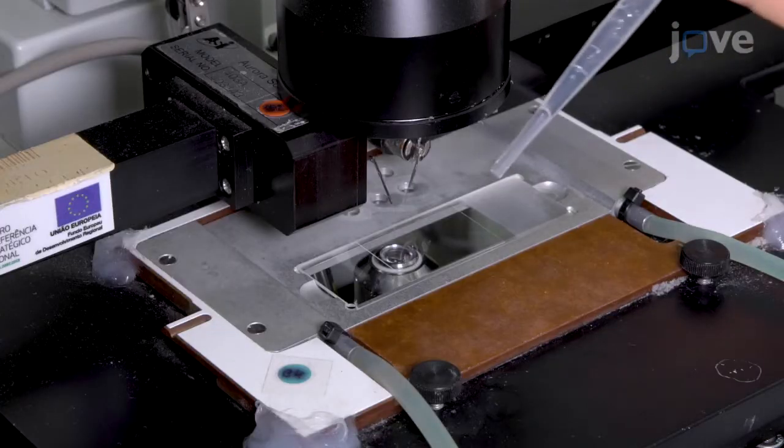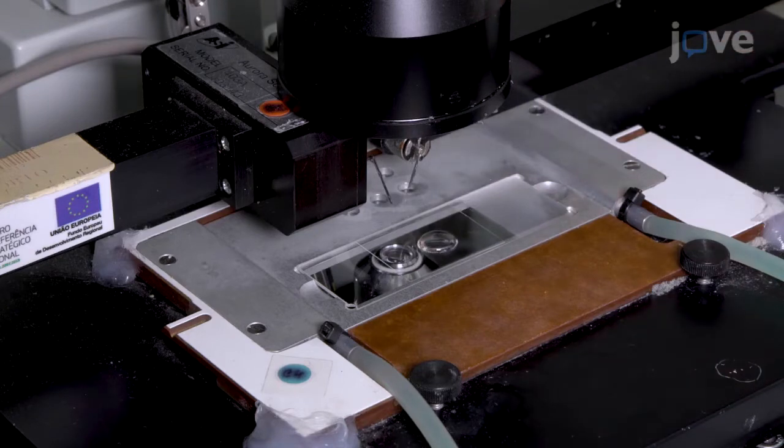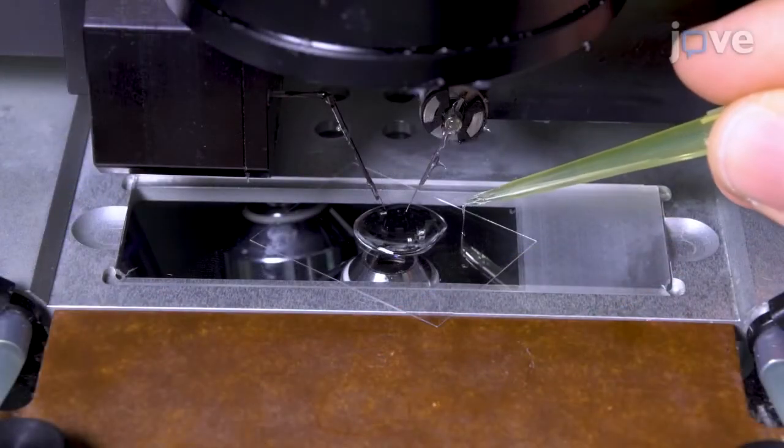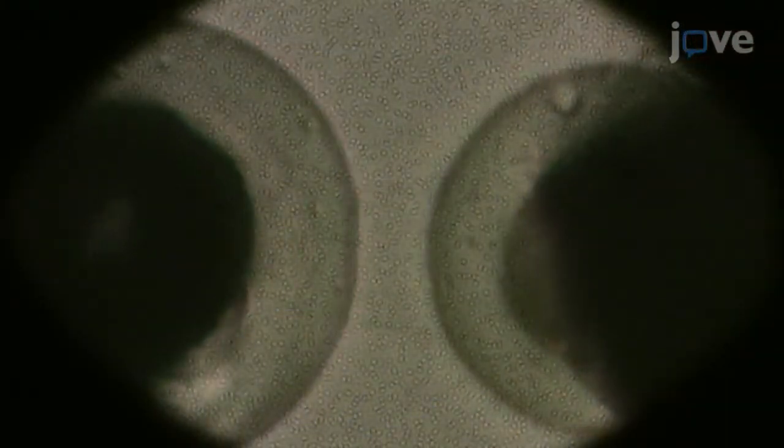Before attempting an experiment, it is advisable to practice the cardiomyocyte extraction a few times to learn how to select, glue, and activate cardiomyocytes with a good size, striation, and shape.